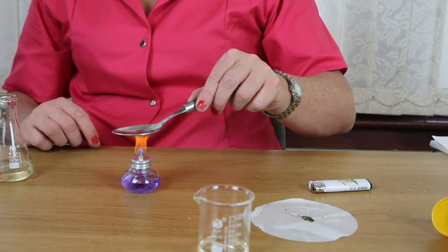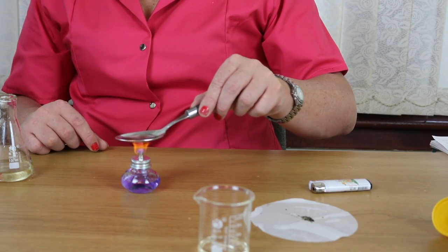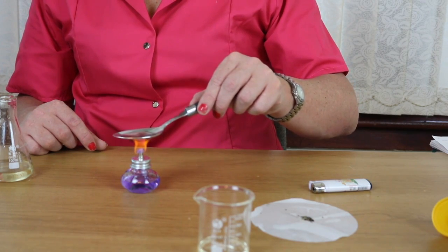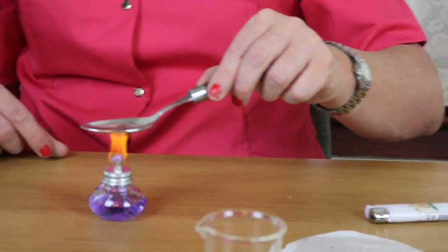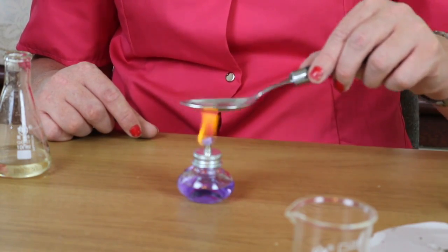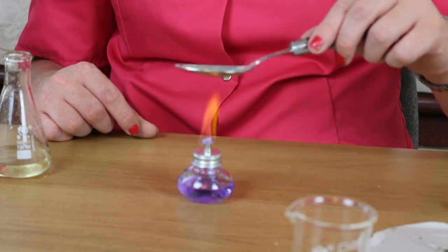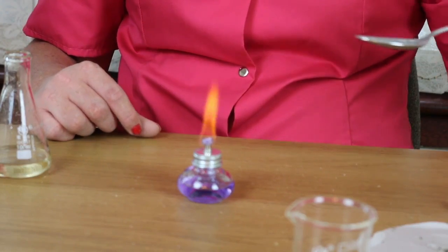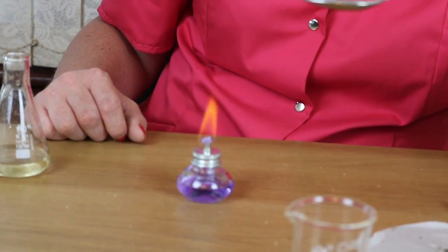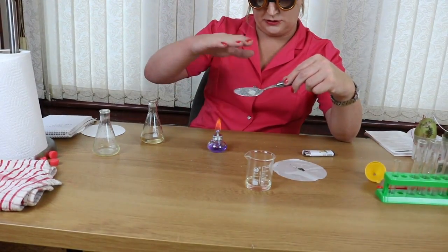Now this is going to let the water boil off, or as we call it, evaporate. So this liquid is going to get very hot and we're going to start seeing it boil. So it shouldn't take too long. And there you are. As you can see, now all the water has been evaporated off. And that's some evaporation.